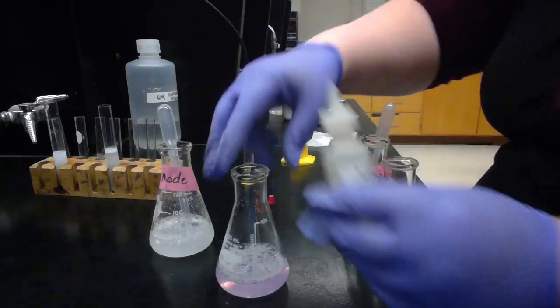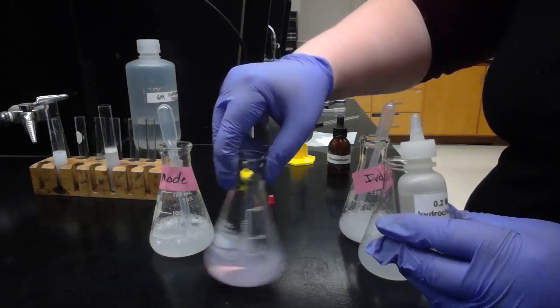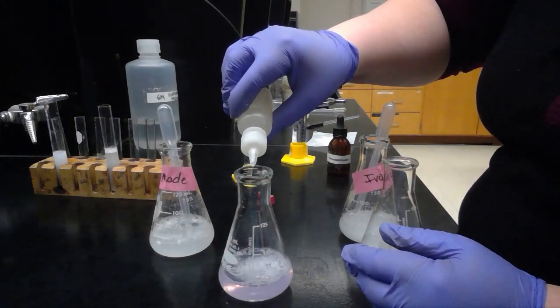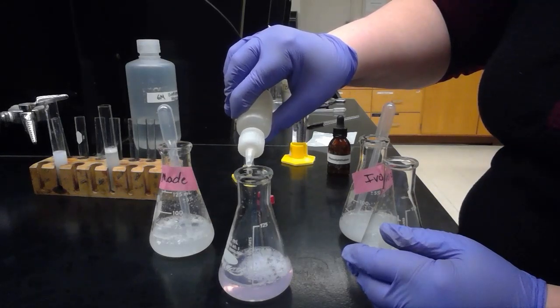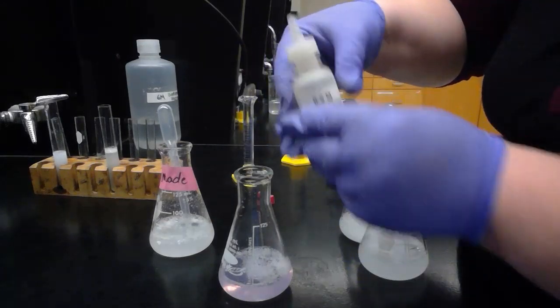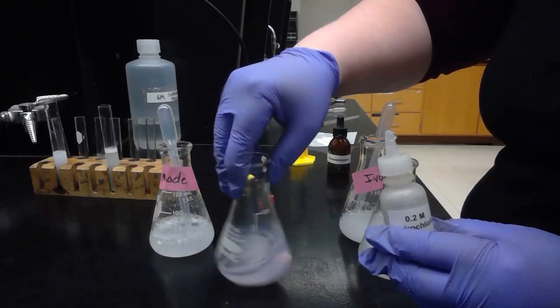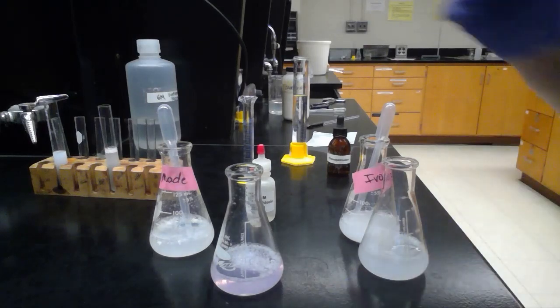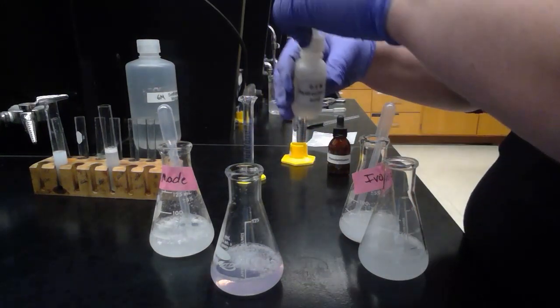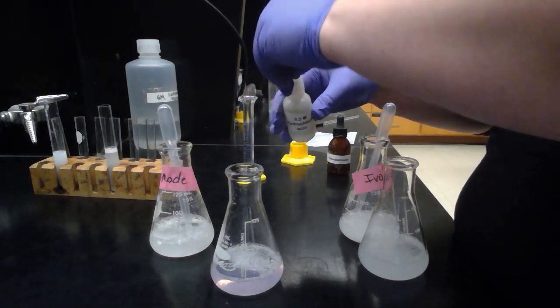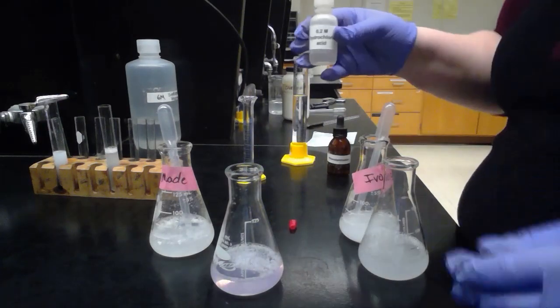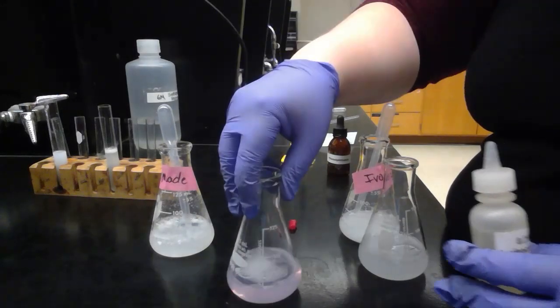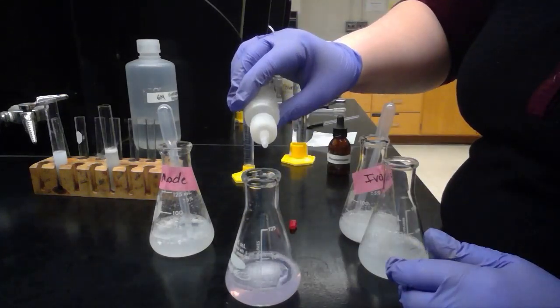That's one drop. I'm going to swirl in between. Still pink. There's another drop. Swirl in between. Here we'll do a third drop. We still have just a slight amount of pink color left in our solution. We're getting close to that titration.